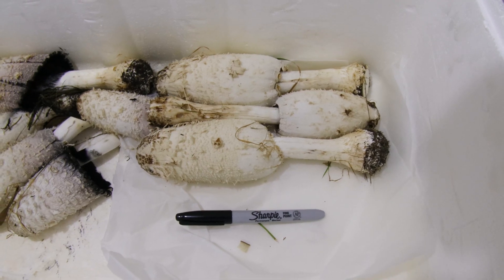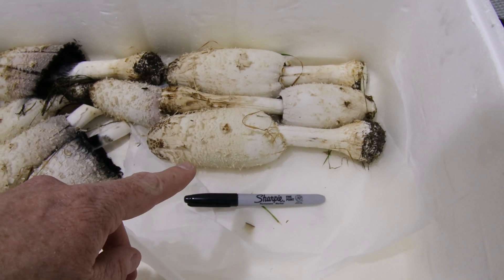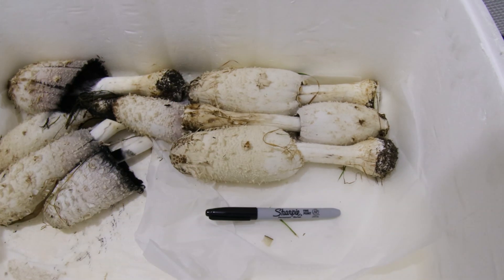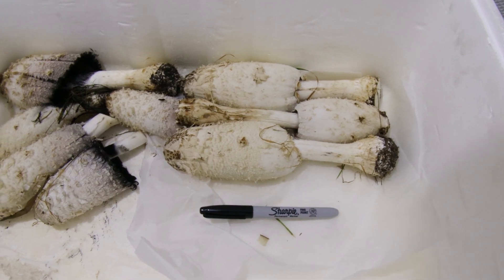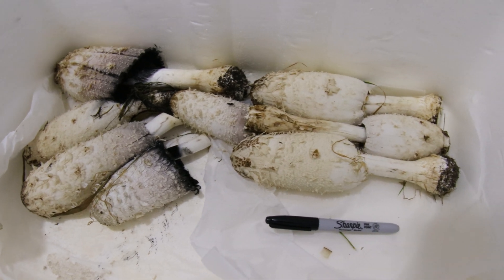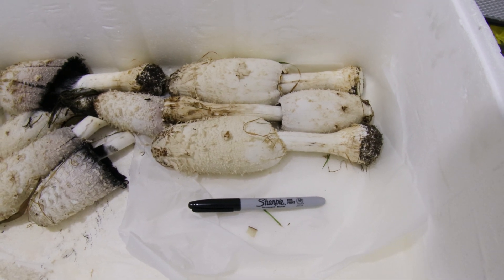These are some nice specimens of shaggy manes — you can see the sharpie there for size. The big ones I saw today were about five times the size of that, just enormous things, but they were already half digested so I got these ones. The field I found was really large so we'll definitely be returning after a bout of rain to see if we can get some more. Anyway, we're going to try and get some cultures from these.